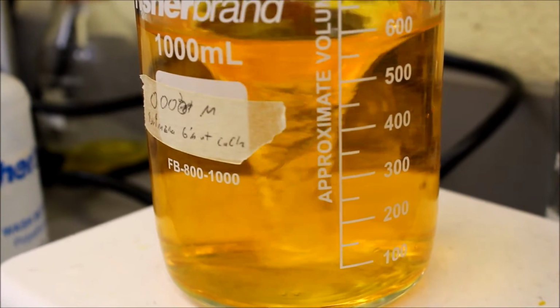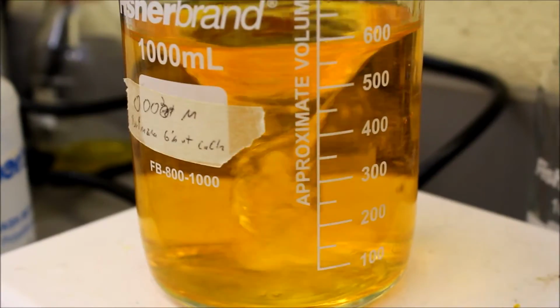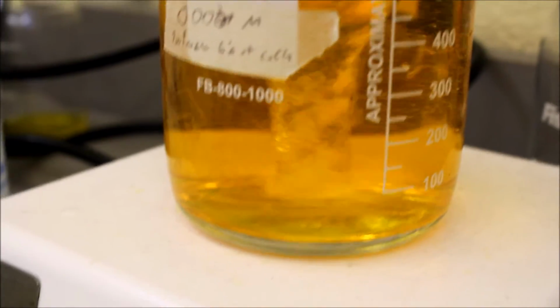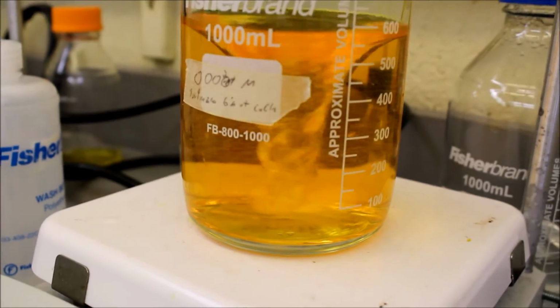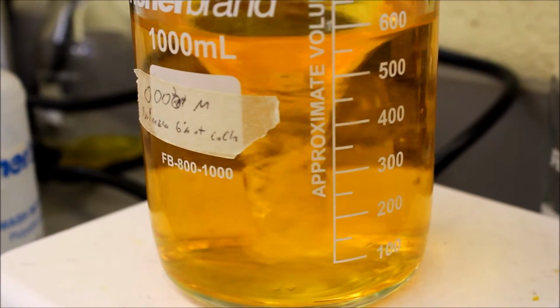Create 1 liter of a solution that is 0.5 gram per liter tartrazine in DI water. Make alginate solution. Add 0.1 gram per 10 milliliter of 0.5 gram per liter tartrazine solution. We need about 300 milliliter of solution. Stir until a smooth, uniform yellow solution is formed.